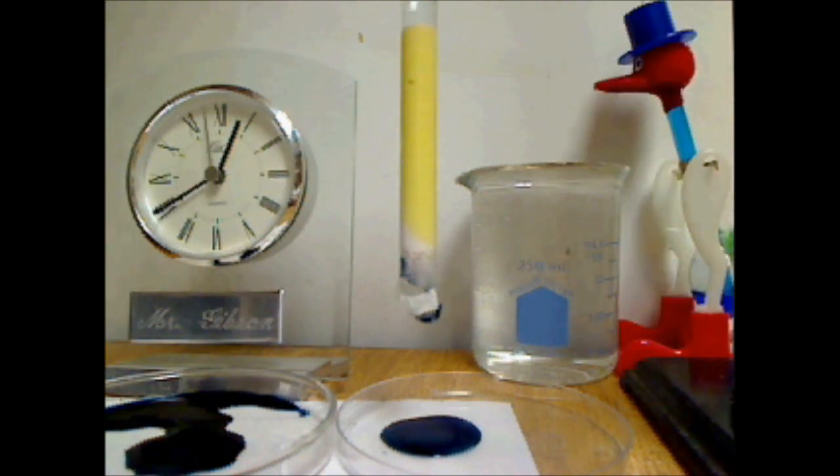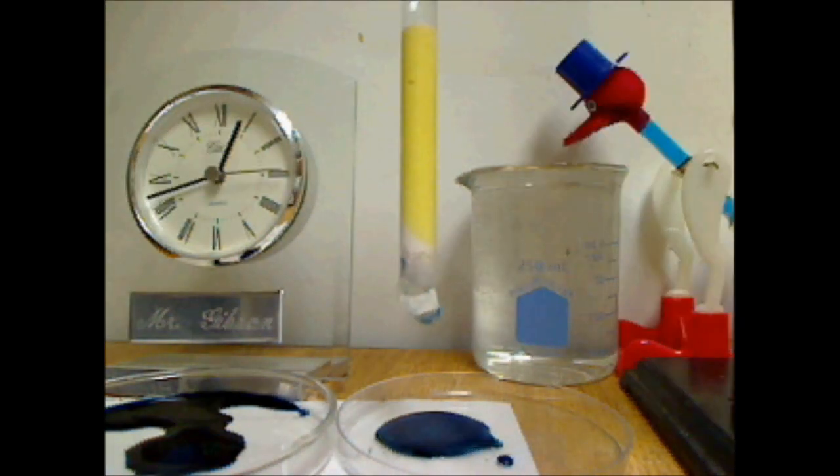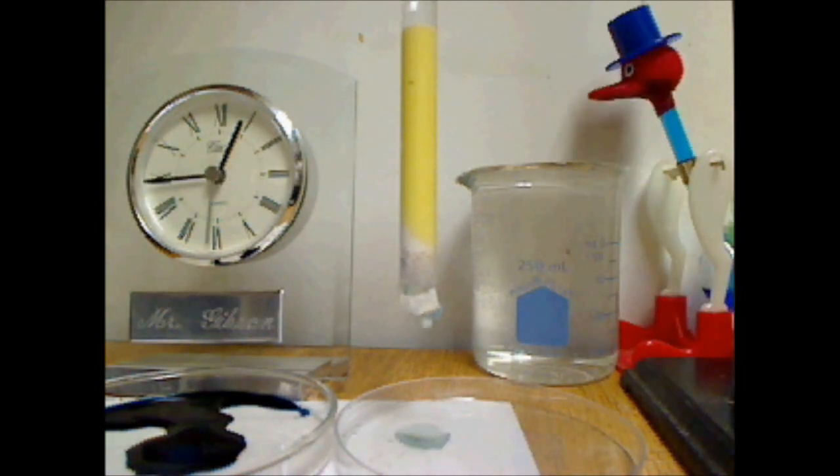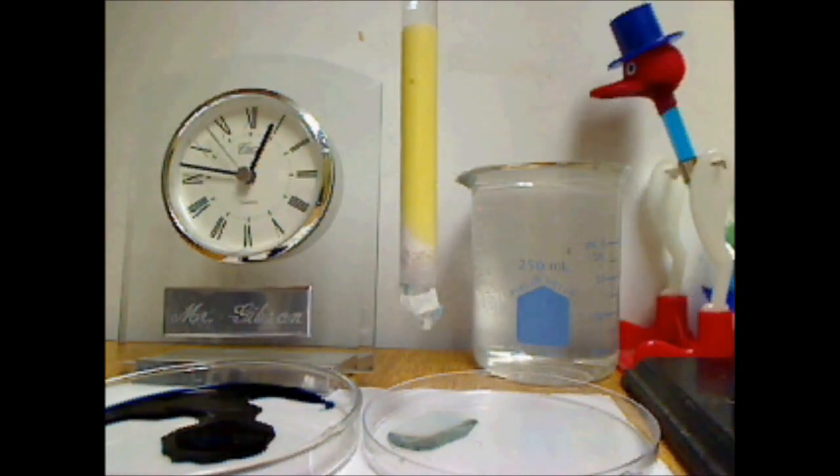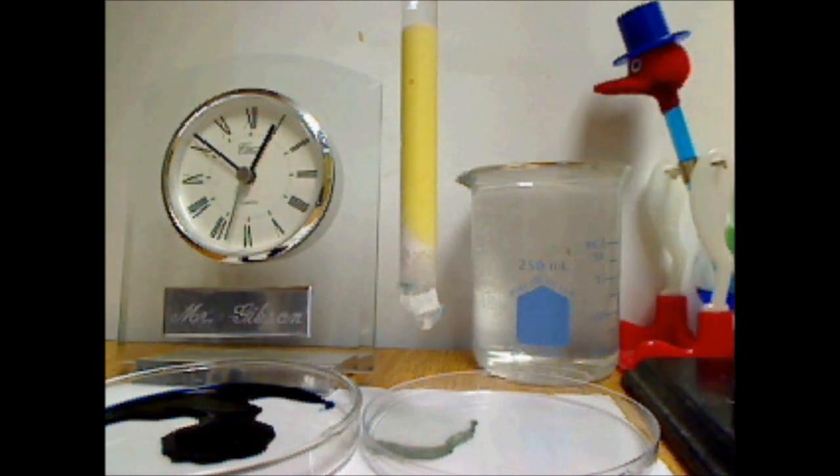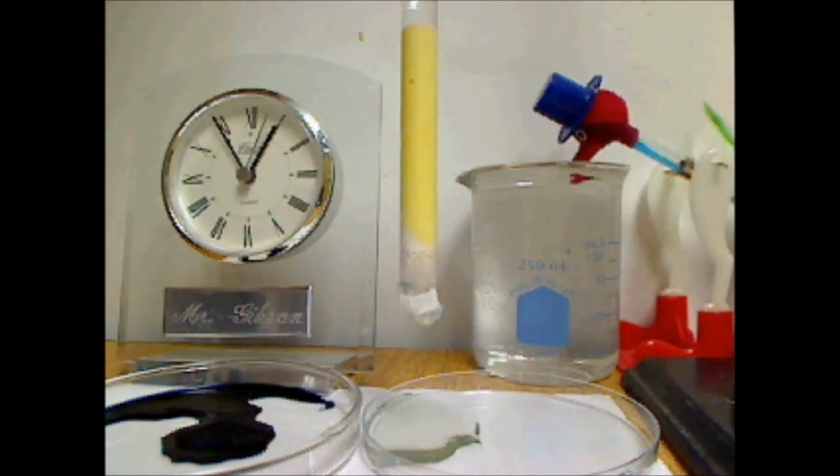This sample here I will discard, because it's blue and yellow. And now I hope to collect the yellow sample. Now you can see the yellow's not really following through with the mobile phase. There's a little coming out, but not as much as I would have liked.